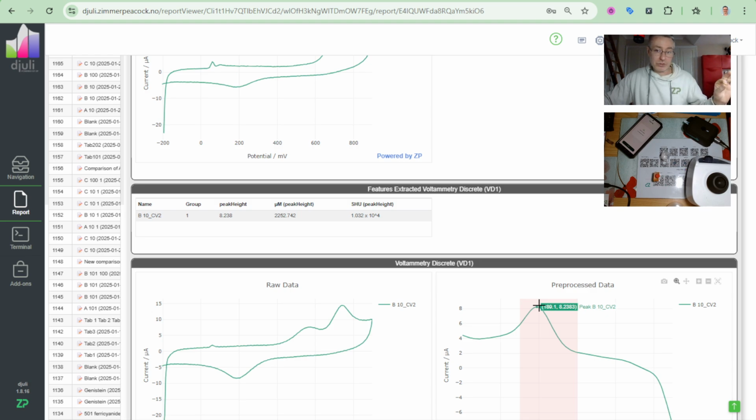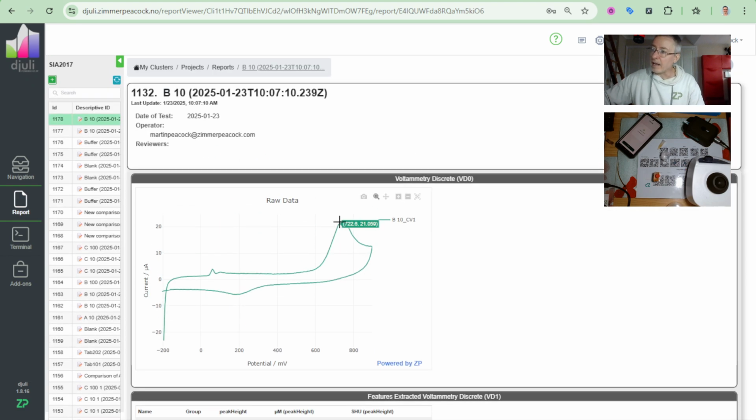Now what I want to do now is, I've got this sample. This sample is that 1 in 10 dilution. So when you get this, you can essentially troubleshoot yourself in real time now. Because when I look at this, I can see my peak 1, I can see my peak 2, I can see my peak 3. I can actually see they flatlined here. They were just a bit higher than me, but only just.